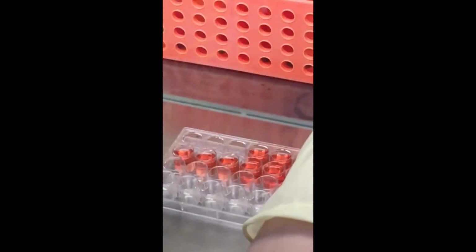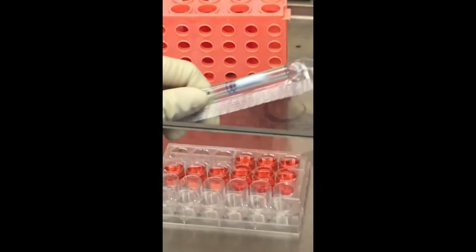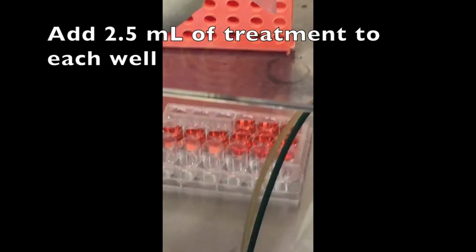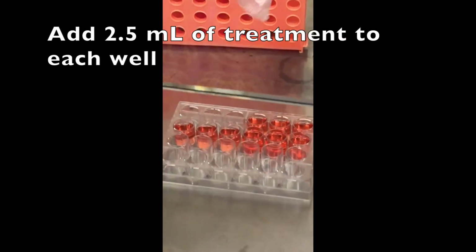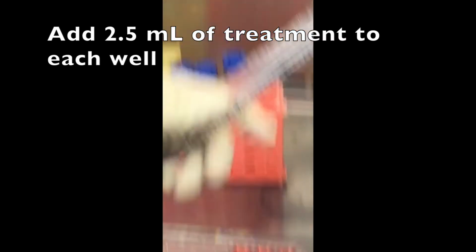Alright, you can use the same vacuum pipette as long as they're all the same cell line. Make sure it doesn't touch anything, so you can just set it right back in there. Okay, so these first are my untreated. I'm going to loosen the lid, and using one pipette, I can pull up 7.5 and then let out 2.5 at a time. Make sure you turn it where you can easily see the numbers.